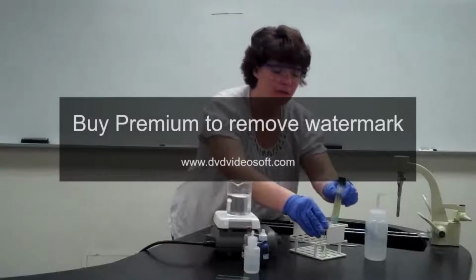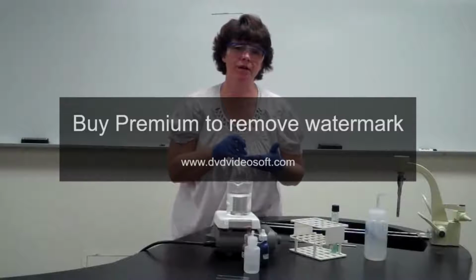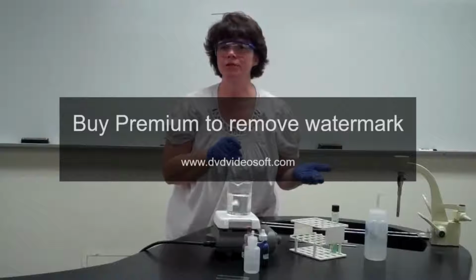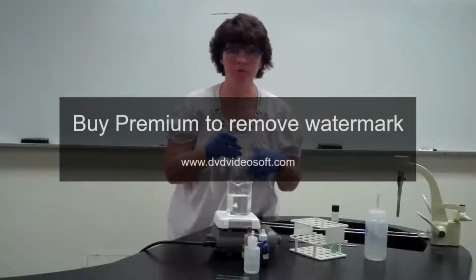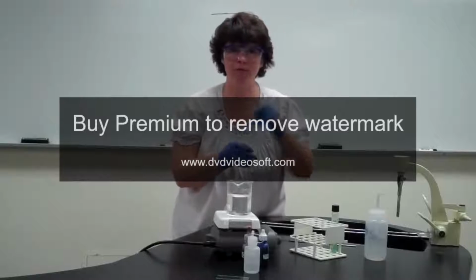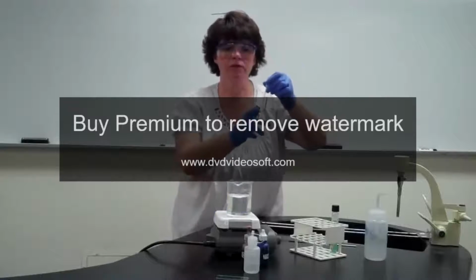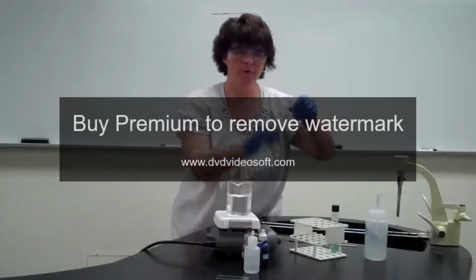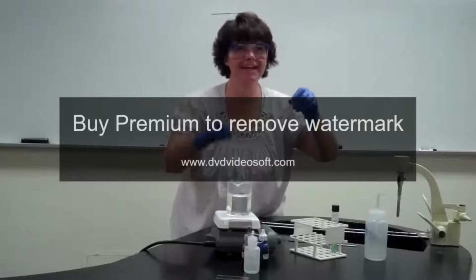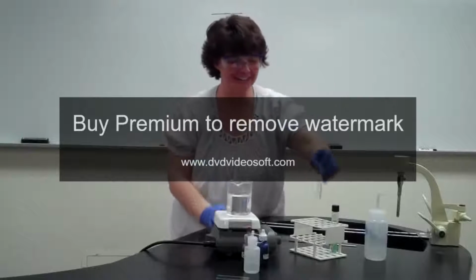Now, depending on how they grow, Mycobacterium is different from a lot of bacteria in the fact that it grows really slow. Some of them can take several weeks to grow. This one we're hoping will grow up in about 4 days. So if they grow up properly, they're going to be in a normal broth tube like we're used to seeing. So you would just do your flicking, pull the bacteria out using your aseptic technique, and put it on your slide.